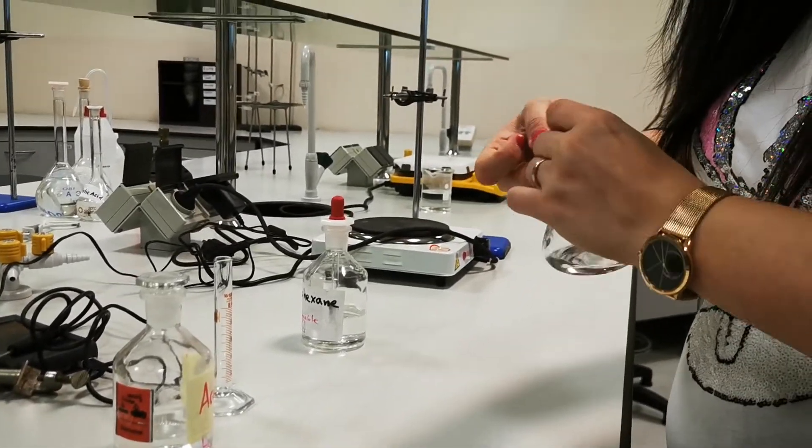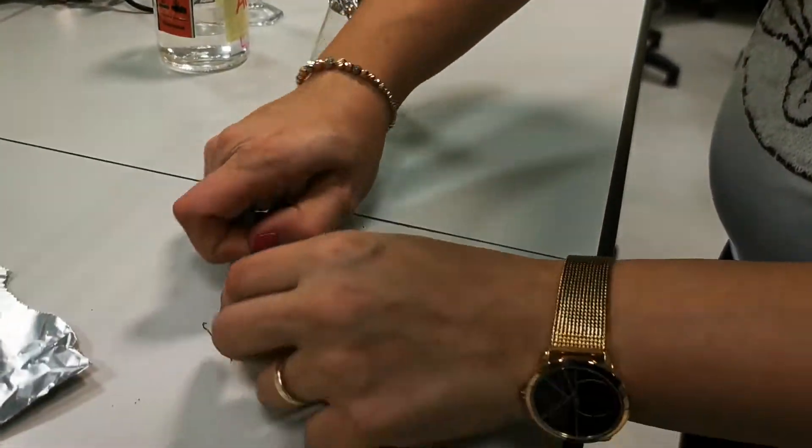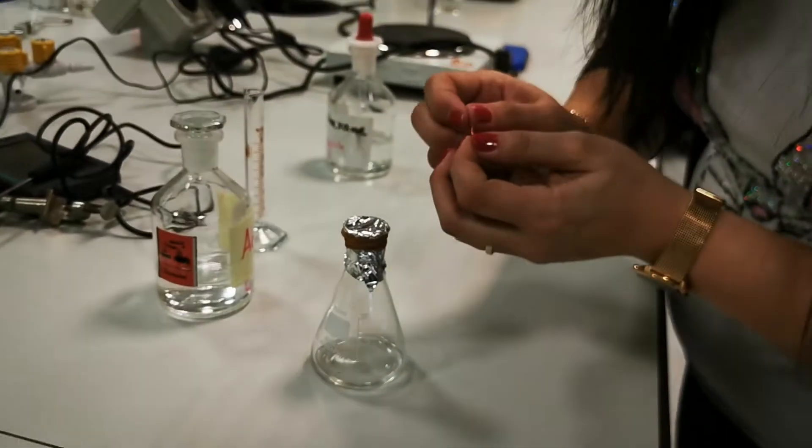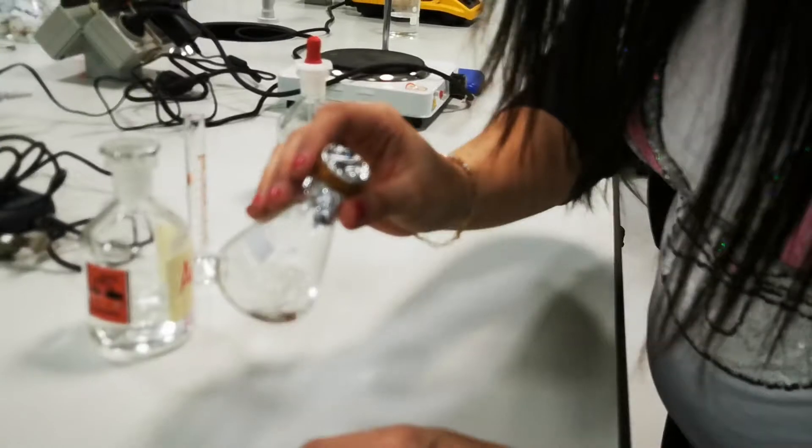You need to create a small hole in the aluminum foil. I'm going to use this one. Just a small hole. It doesn't have to be big. That's enough.